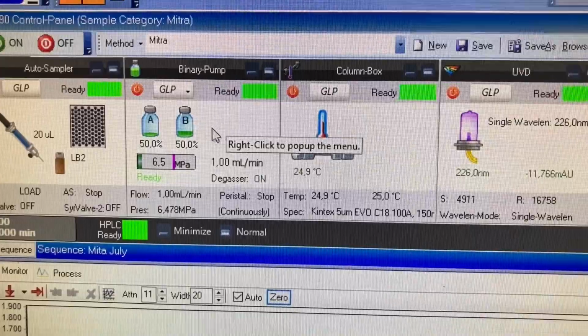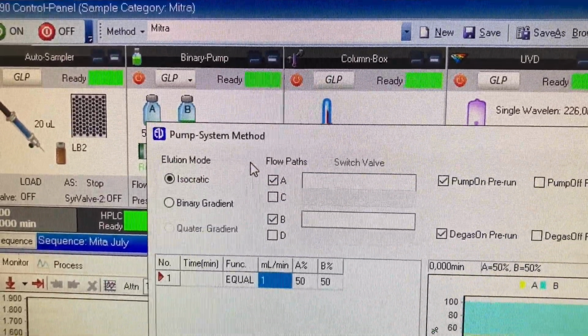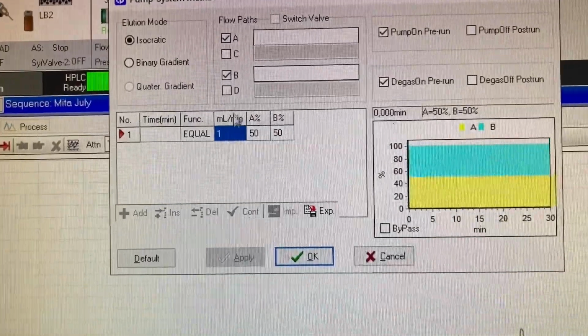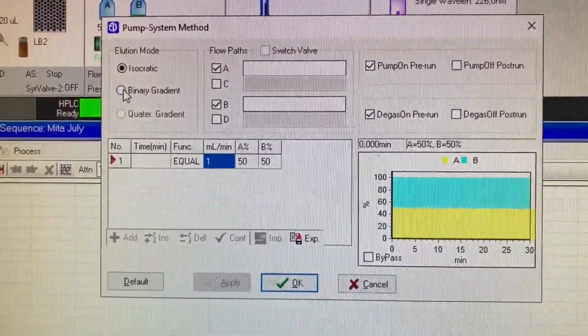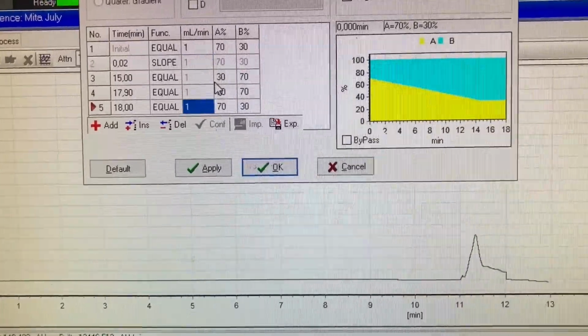So I'm going to change this. I'll show you here. Go to method, to binary gradient, and the pressure's going to build up, and if it blows out, that's where it's going to do it once the pressure builds up. At the same time, we can see the settings.